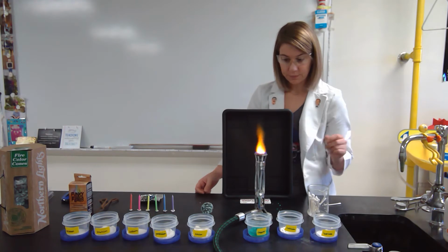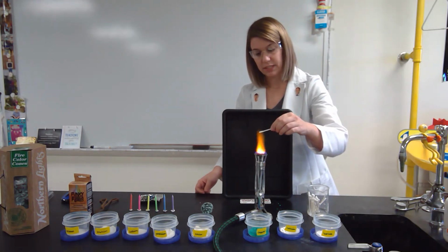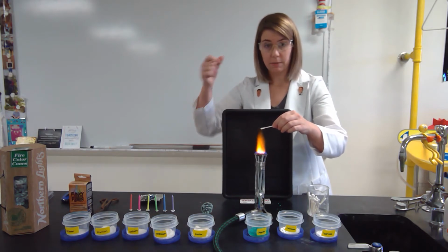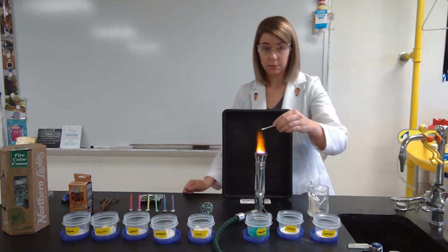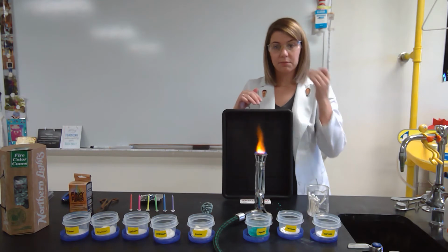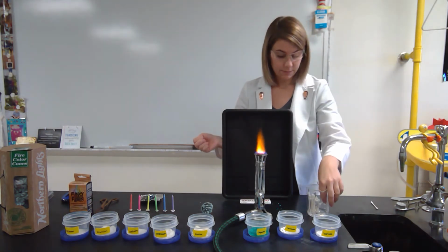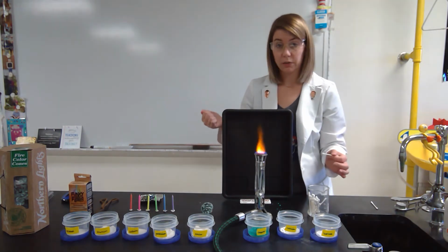and go from there. So what I'm going to do is take each of these Q-tips. I'm going to hold them at the very tip of the flame whenever they have the chemical. And we're going to observe the flame test above that flame. So I'm not looking at this lower region here for my flame test. I'm going to look at this upper region here. Part of the reason why I have this black box is to help you see the color of the flame test. Now, in your lab papers, you're going to record what colors you see.